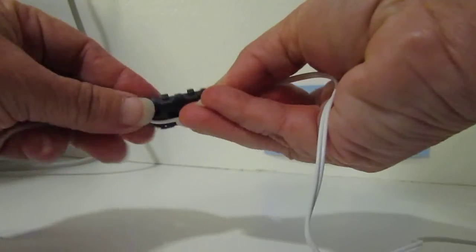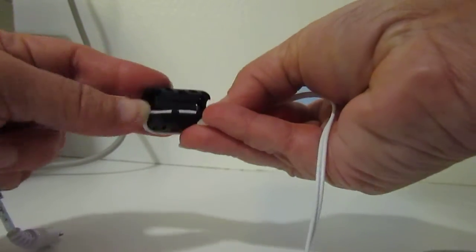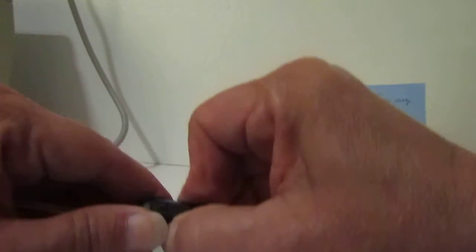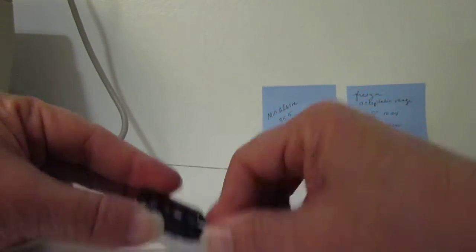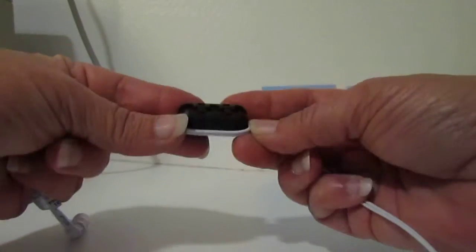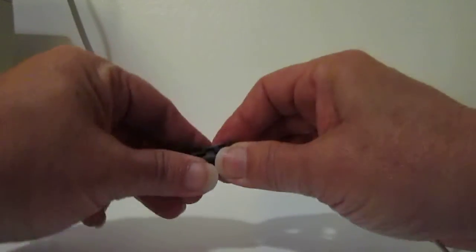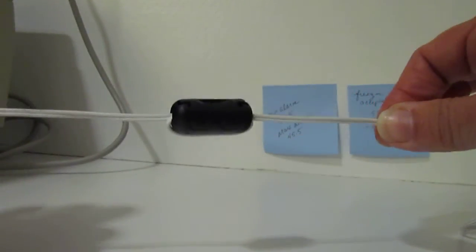Try to keep it flat so it's easy to close and then you close this little puppy and it ain't easy. You got to make sure that cord's nice and flat. Okay and now it's protected.